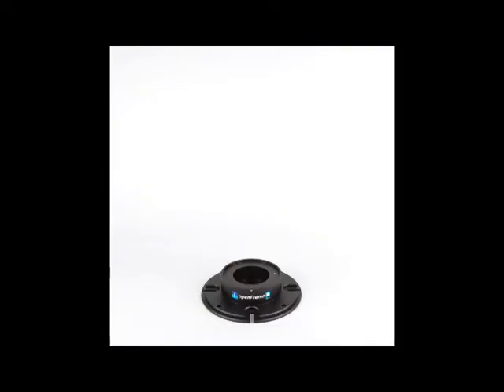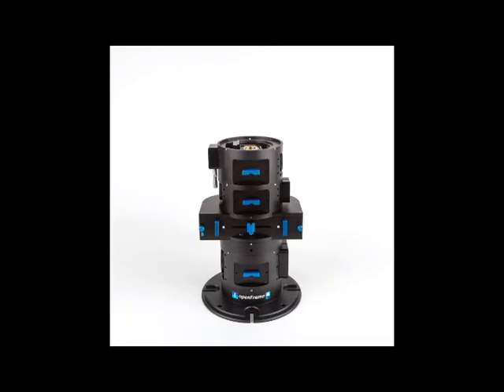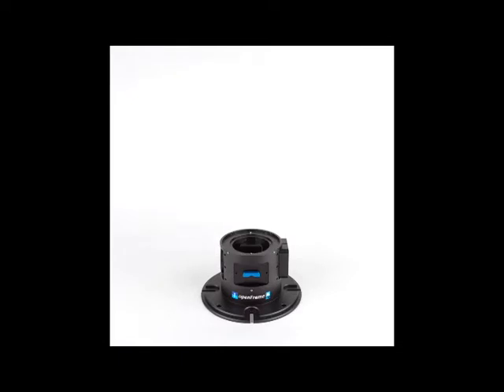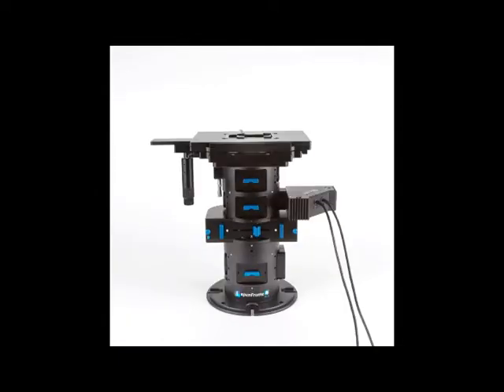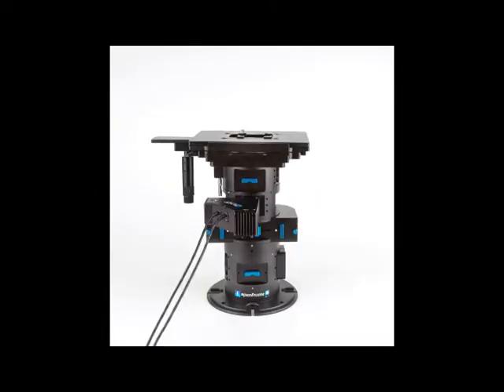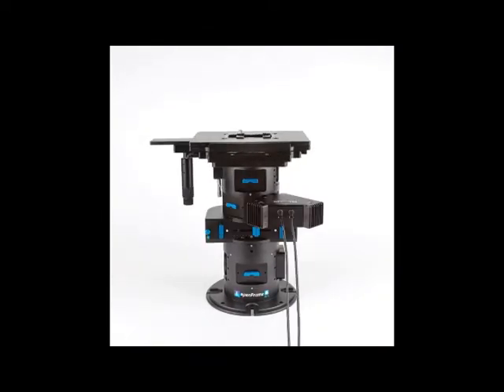Yeah, and here's one example of that, which we're going to go into more detail of later. In this next clip, we're just going to illustrate the modular format of the openFrame. So enjoy. Here you can see the layer-by-layer build of the openFrame, illustrating the modular format. Each layer can be positioned at a range of angles at any 45-degree increment.